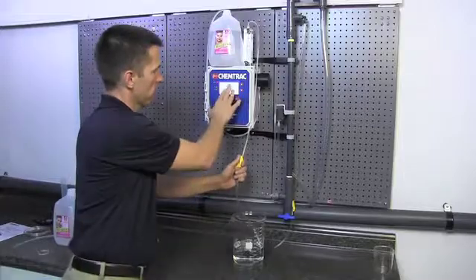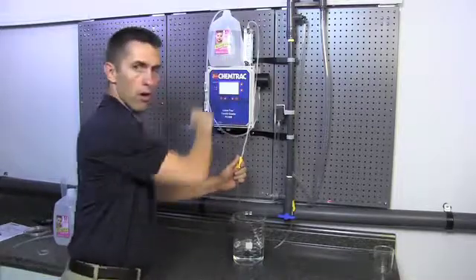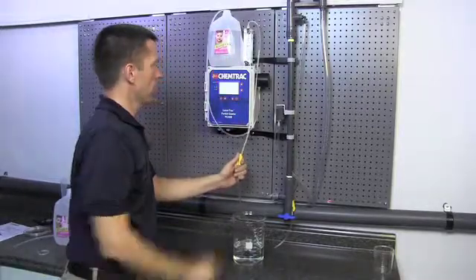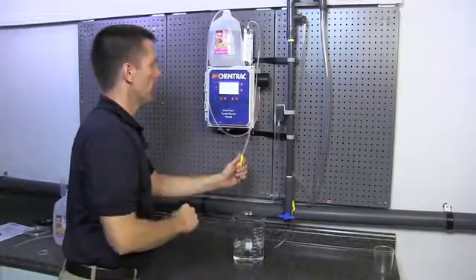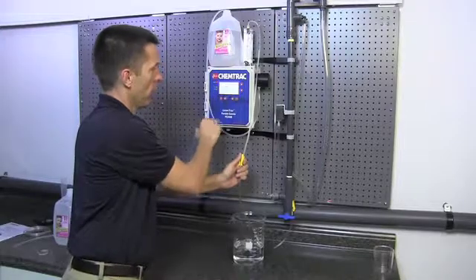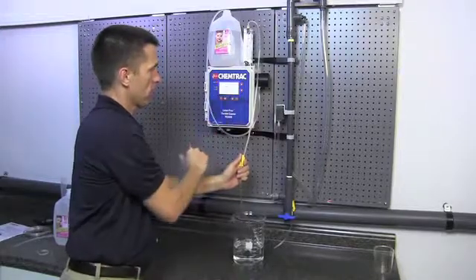What we're looking to see here is how many counts are in what we call the blank water solution. Now, this is not the jug I'm going to be using for calibration. This is our flush water jug. But I am just kind of curious to see that this particular jug of water appears to have around 70 or so counts.